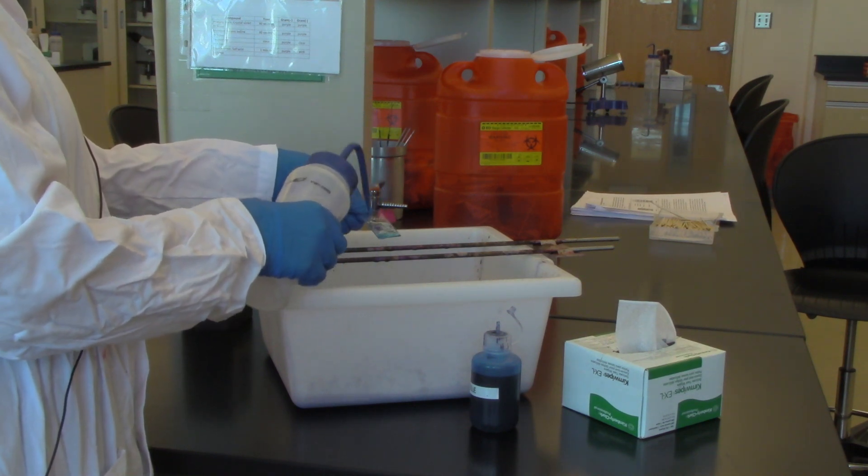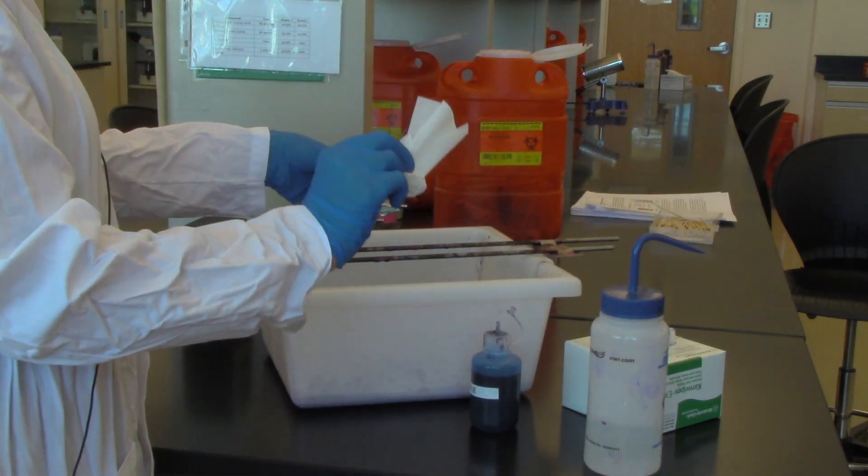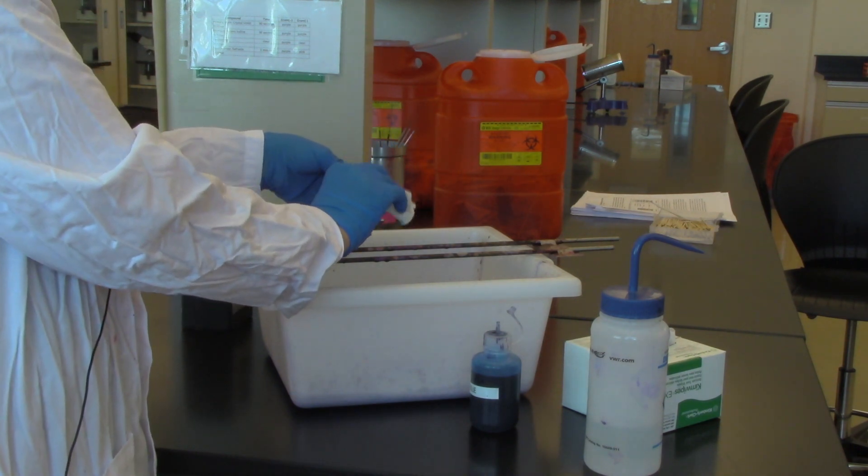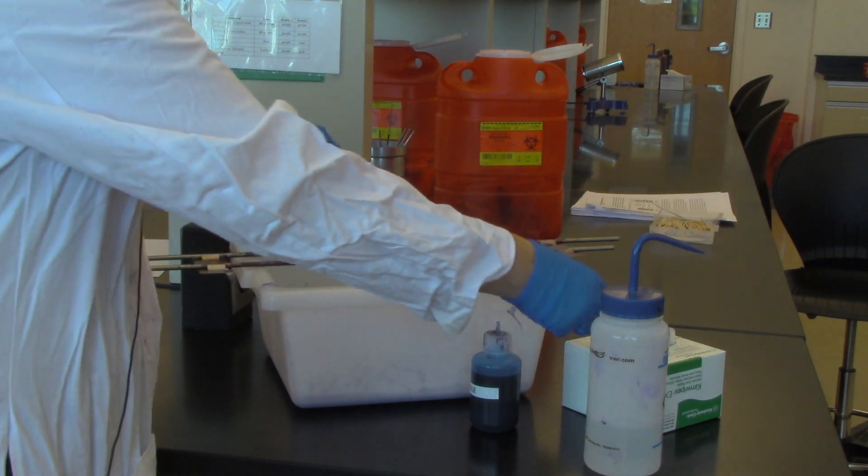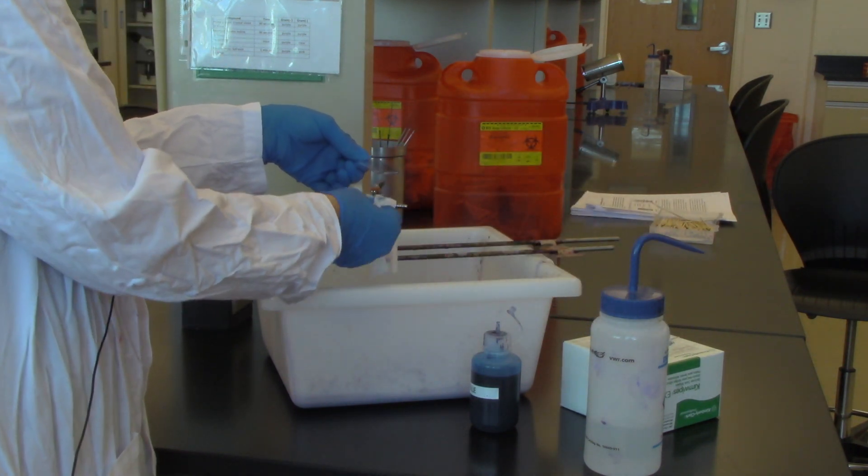I'm going to get all that excess dye off and I'm going to have excess moisture on the slide, so I'm going to take a Kim wipe. I do not want to rub because I'm going to rub off the specimen. I'm just going to dab and you can also use some to wipe off the base as well.